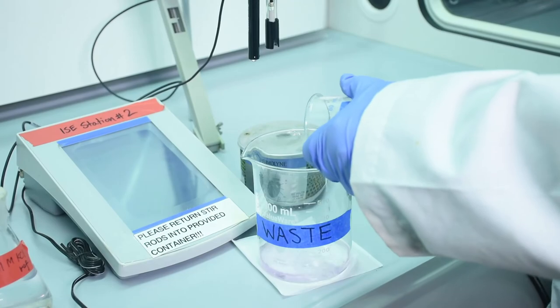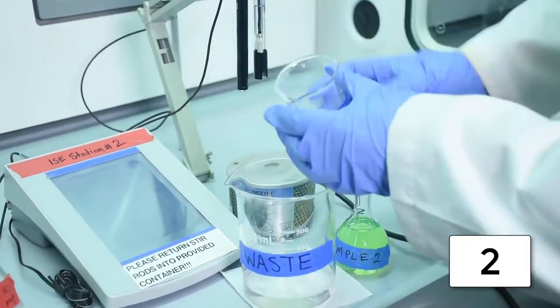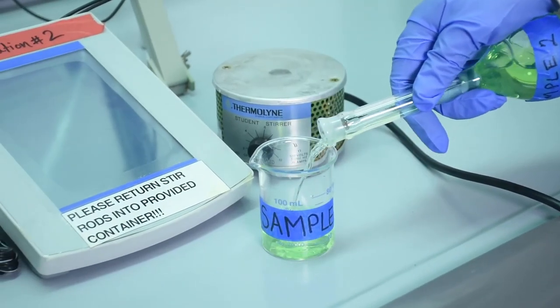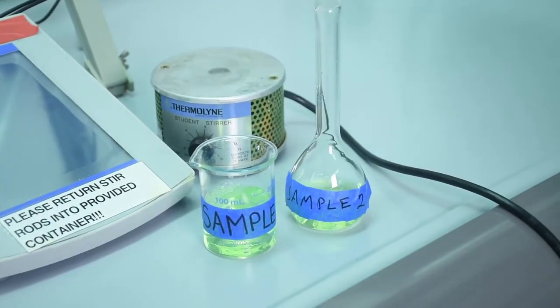Rinse the sample beaker with the next standard to be analyzed. Then, fill the beaker with the standard being analyzed and carry out the next measurement.